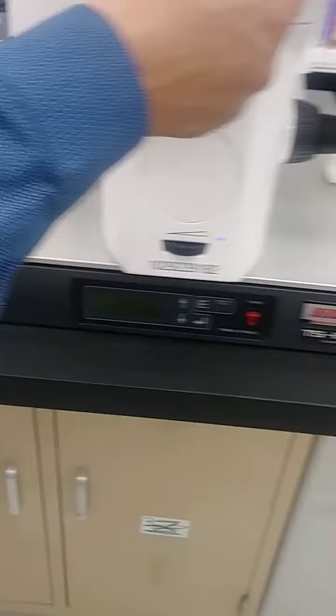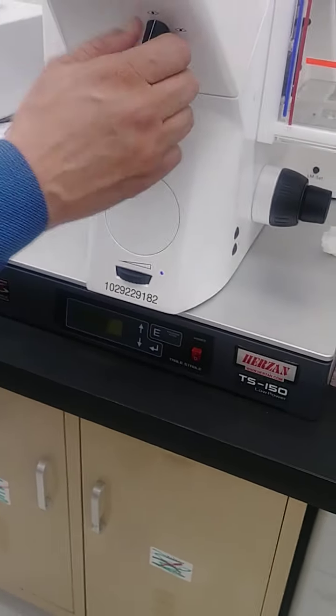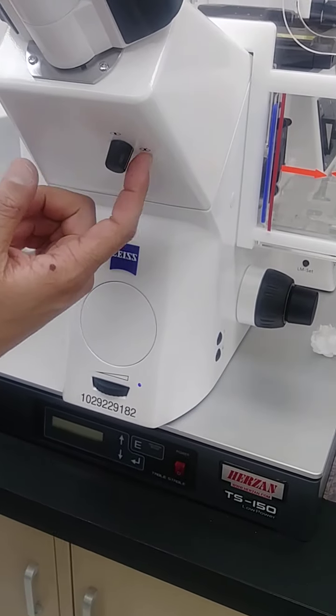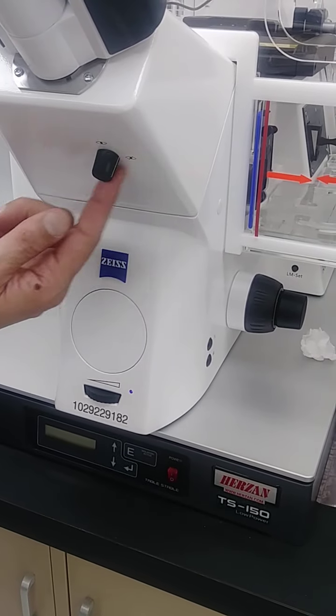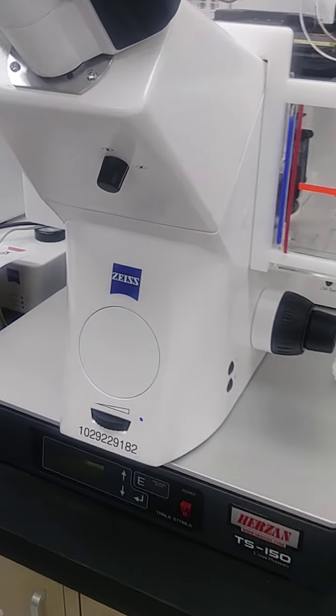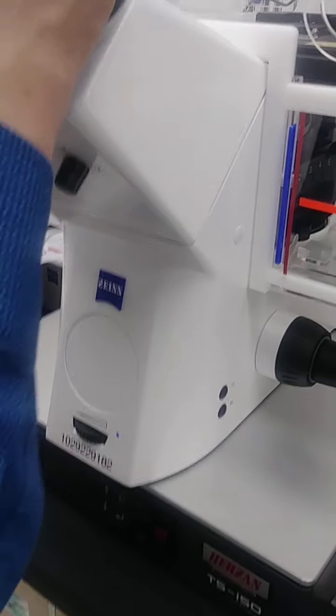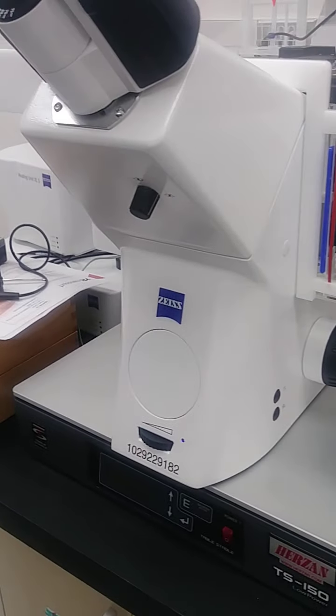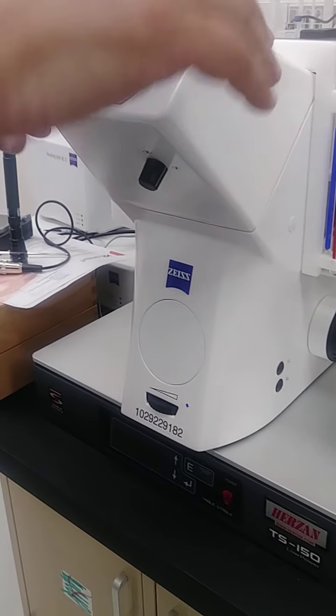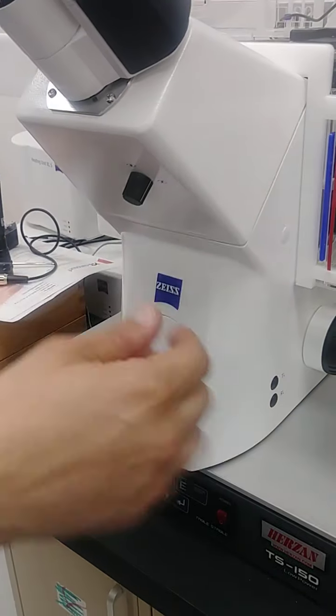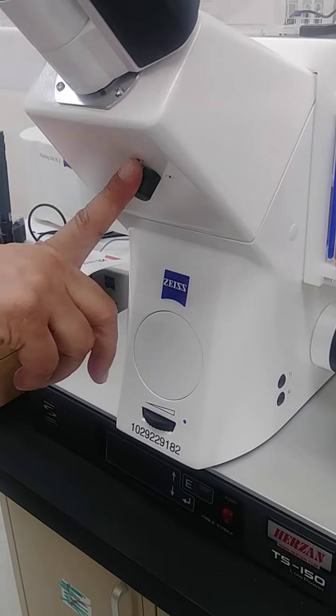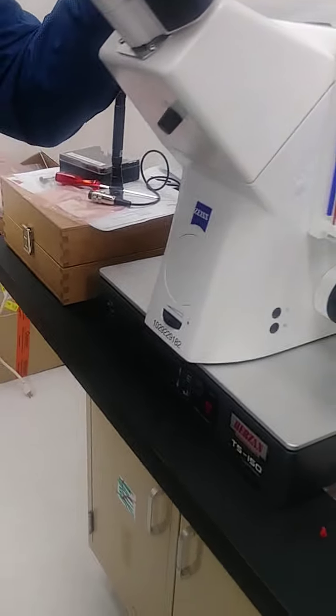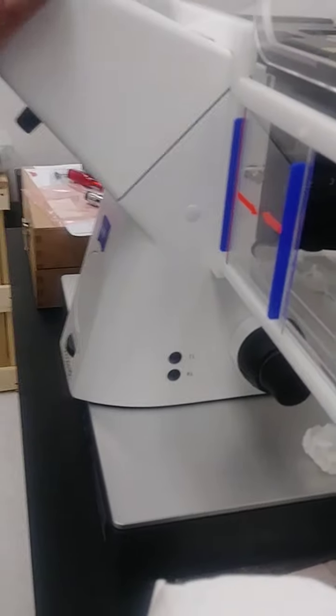And then the other thing, which was what I had this morning, which I was like, I can't see anything, is this guy. This has a thing where when it's on this one, it blocks the light coming through here, which means you can't see through it. You do that if you're worried about this projecting onto your fluorescence image. But I'll leave it open.